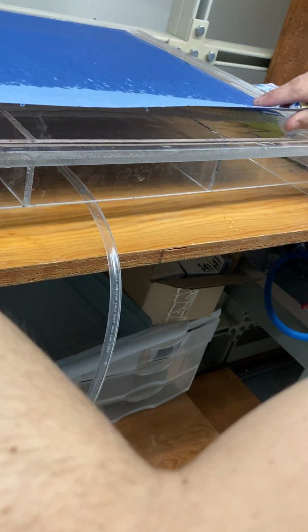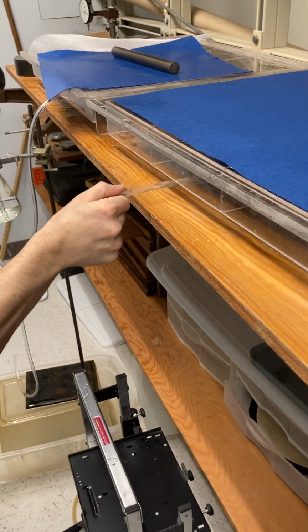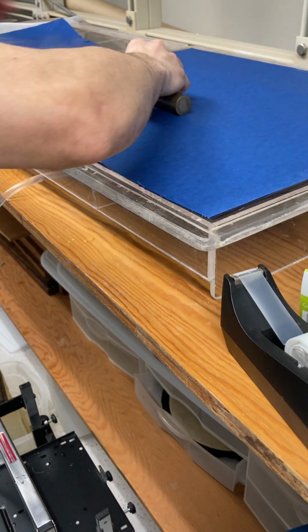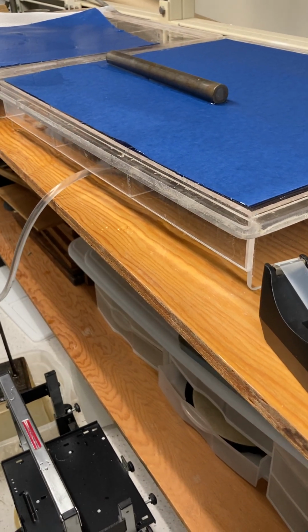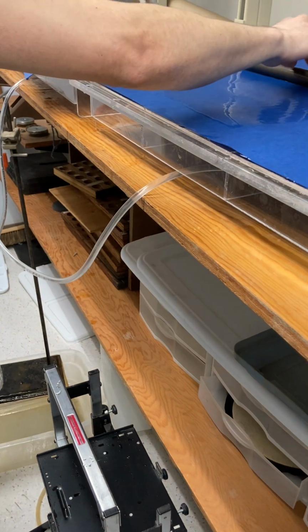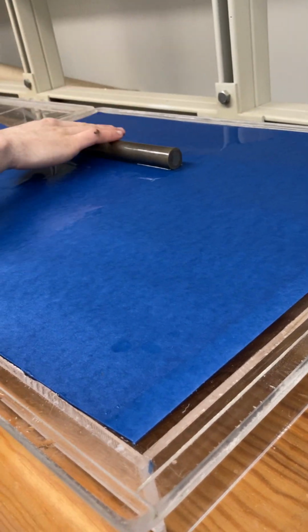Yeah, and that won't all go away until you have some suction on it because of the bend in the screen. So the screen's going to continue to just bend up again. It's kind of pretty watching it saturate. Okay, let's try this again. There's the bubbles coming out very quickly. So he's going a little slower on the edges than he is in the middle.